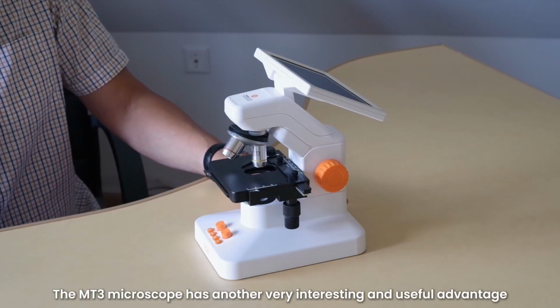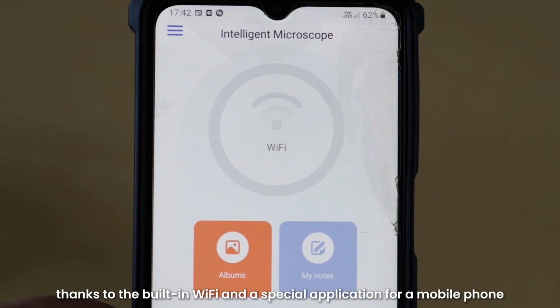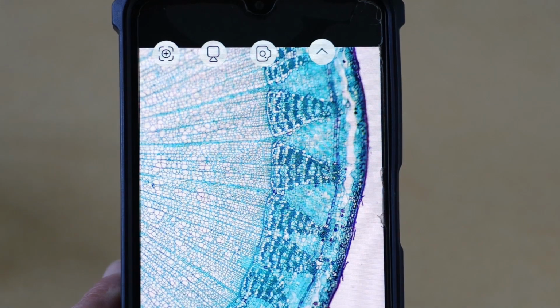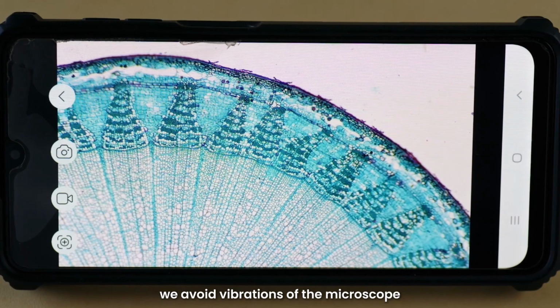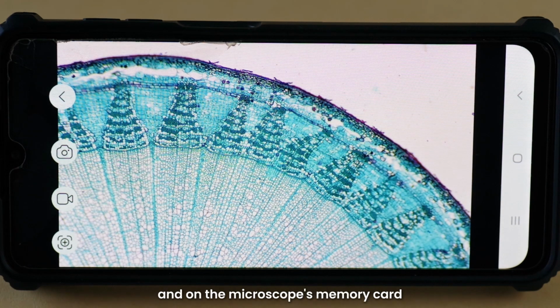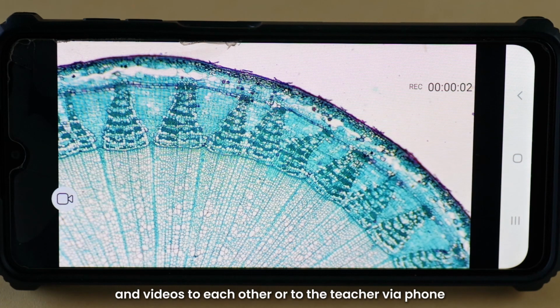The MT3 microscope has another very interesting and useful advantage. Well, thanks to the built-in Wi-Fi and a special application for a mobile phone, we can take photos and short videos from a mobile phone without touching the microscope. Thanks to this, we avoid vibrations of the microscope, which may result in blurred photos. Photos and videos taken in this way are saved both on the phone and on the microscope's memory card. Students can immediately send photos and videos to each other or to the teacher via phone.